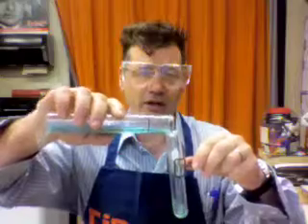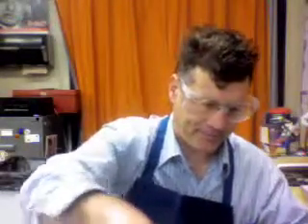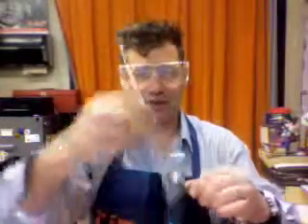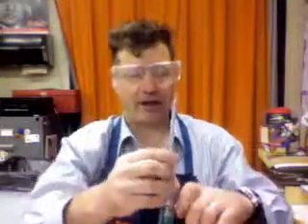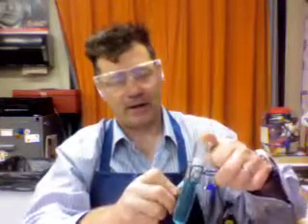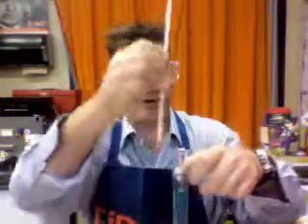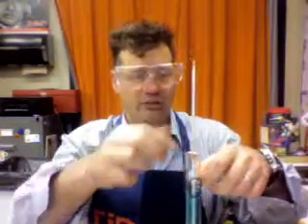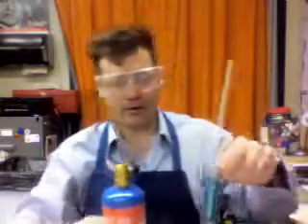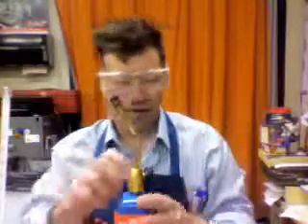And I'll pour that in, along with a thermometer that in this case reads the Celsius scale. And I'll put that in there, and I've got to push my little rubber stopper down, and that will protect the thermometer so it doesn't rattle around too much in the test tube and break something. And then I'll fire up the heat source, and here we go.